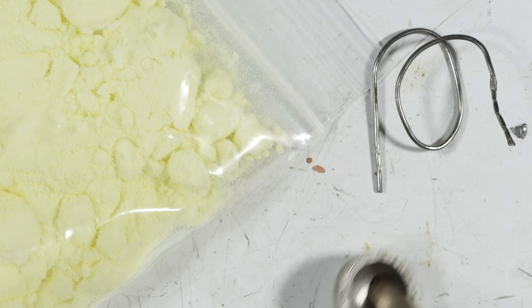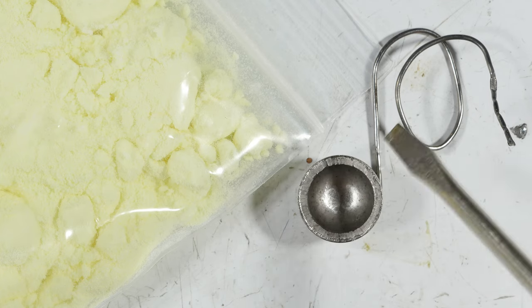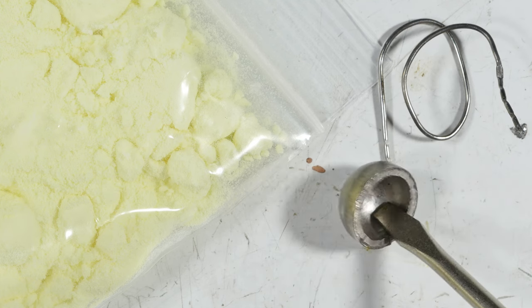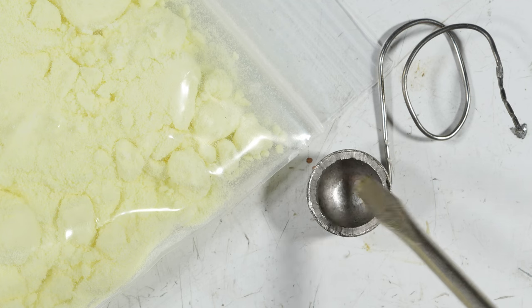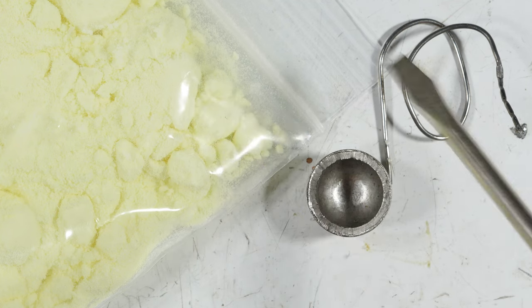So my plan is to chop up the solder as fine as possible and put that ratio in this little metal cup. This is just a steel ball I found online. I wish it was a square edge cup, but it's round. This is the best I could find. And I am going to mix it. Now again, the ratio is 6.5 to 1.